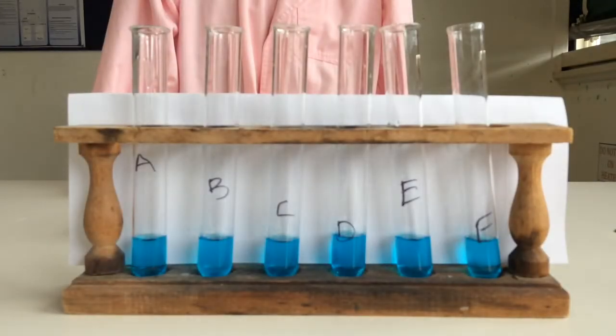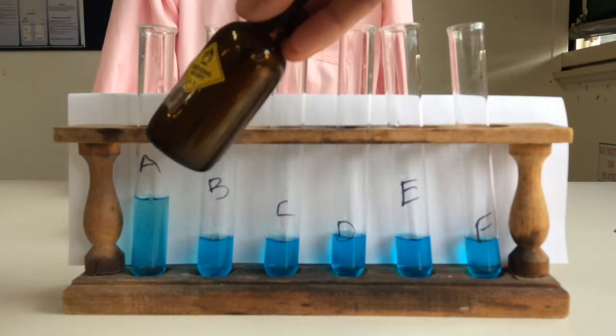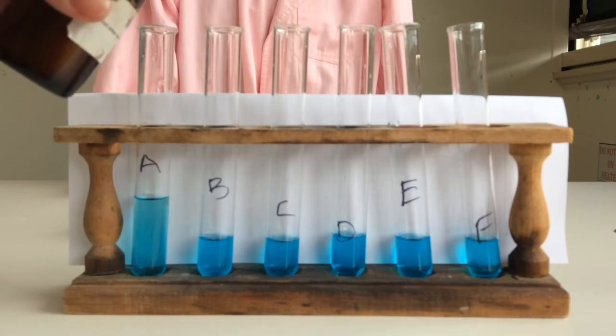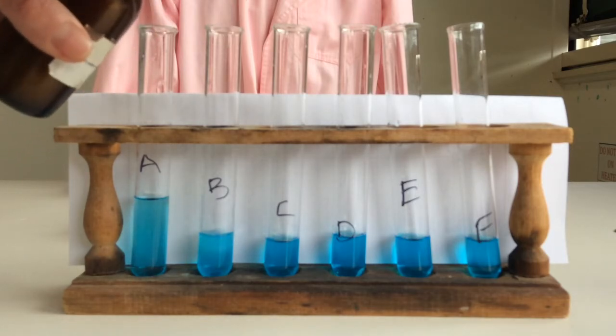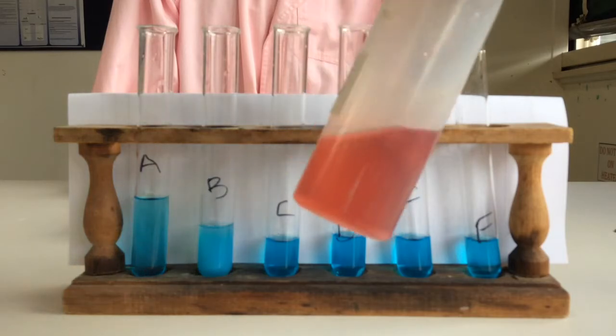Okay, so I've added the copper sulfate. In A, I'm supposed to put sodium chloride, in other words, aka table salt. Silver nitrate, remember anything in a brown bottle shouldn't be placed directly on the surface, and I probably should be wearing gloves here, to be honest. So I better make sure. Cobalt chloride, I'm going to add that one.